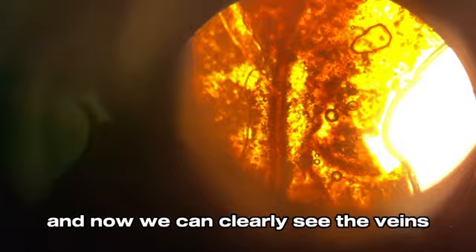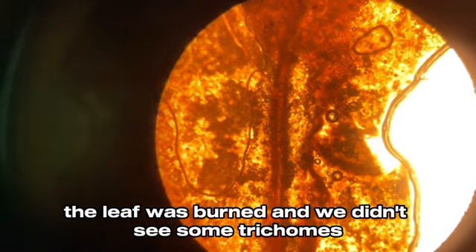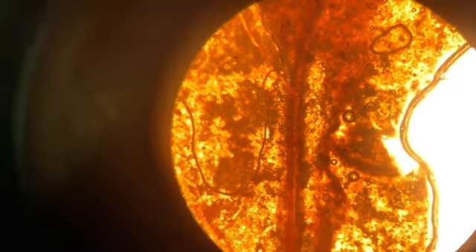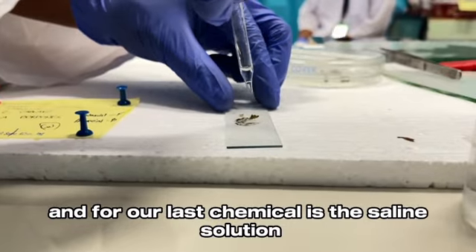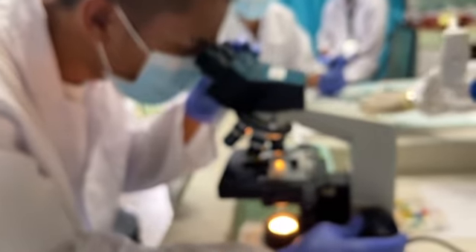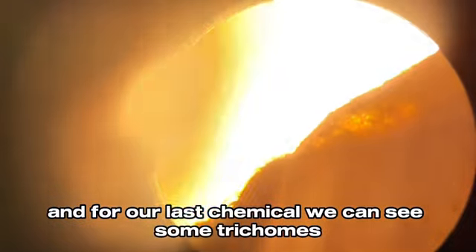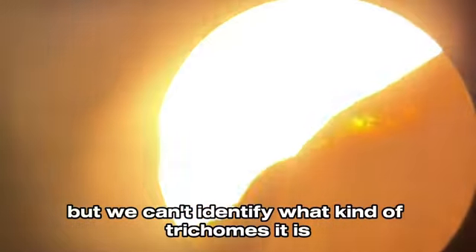Now we can clearly see the veins, but because of the chemical, the leaf was burned and we didn't see some trichomes. And our last chemical is the saline solution. With it, we can see some trichomes, but we can't identify what kind of trichomes they are.